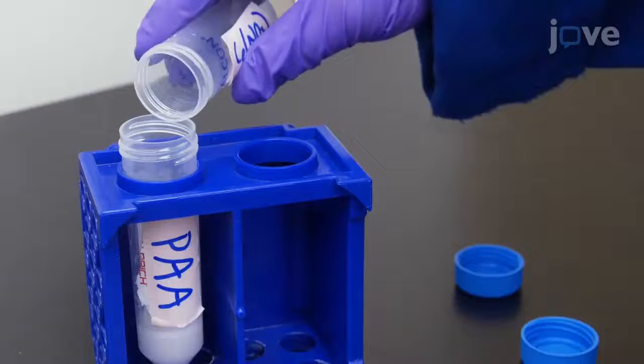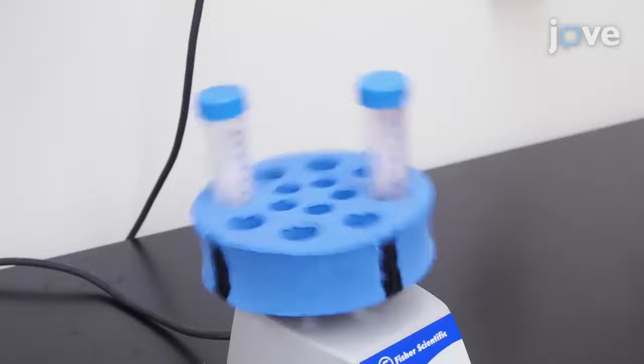Combine these two solutions and then use a digital vortex mixer to mix them thoroughly at 2000 rpm for 15 minutes.